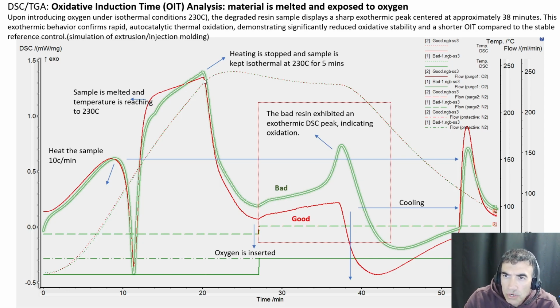We keep the material for 5 minutes at that temperature, and then after that, we insert oxygen at 27 minutes. When oxygen is inserted, the material is exposed, and oxygen starts attacking the material. Oxidation would happen. Here, the role of the thermal stabilizer becomes very important. When free radicals form as a result of oxygen attack, the thermal stabilizer reacts with those free radicals and basically binds them. So they prevent thermal oxidation from happening.